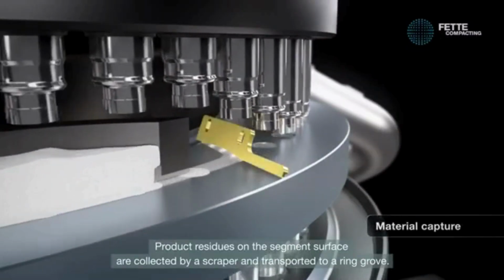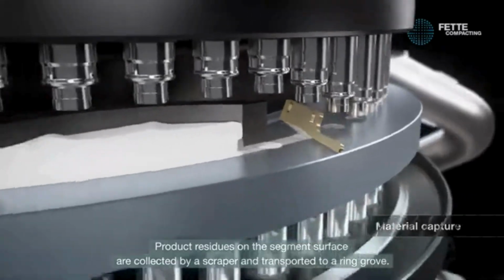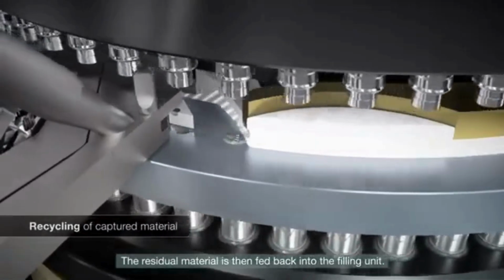Product residues on the segment surface are collected by a scraper and transported to a ring groove. The residual material is then fed back into the filling unit.